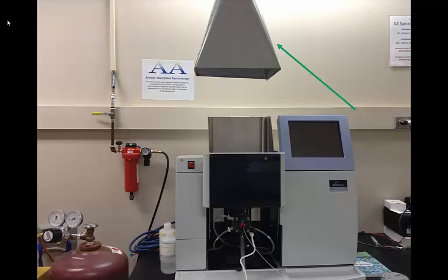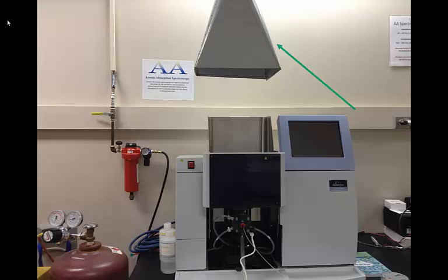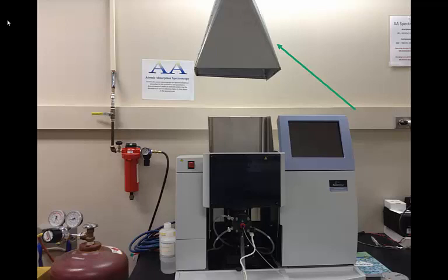We also need to make sure that the vent is open. If you look at the fume hood, you'll see a little lever on the front. You need to make sure that lever is in a vertical position to maximize airflow through the vent. It should also be noted that the ventilation system is shared by the ICP instrument to the left — under no circumstances should these two instruments be used simultaneously. So make sure the AA vent is open and the ICP vent is closed.